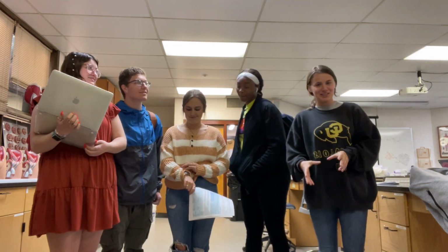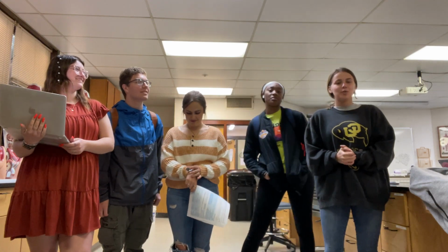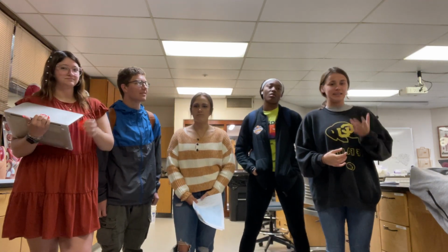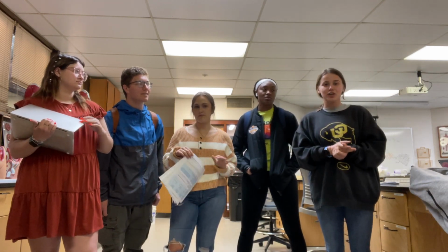Mandy Liz. So today we looked at the perch, which is a fish, and we dissected it. And I think one of the most striking differences between this organism and the previous organisms we looked at is the differences in the circulatory system.